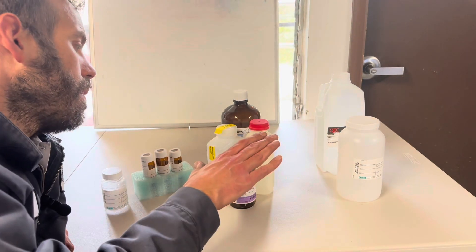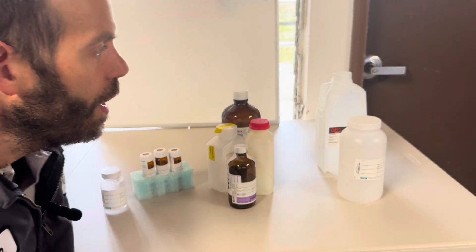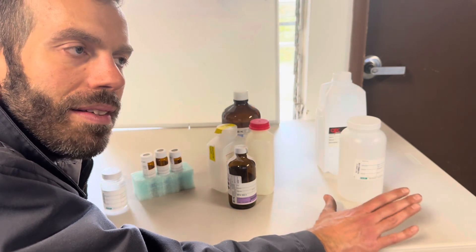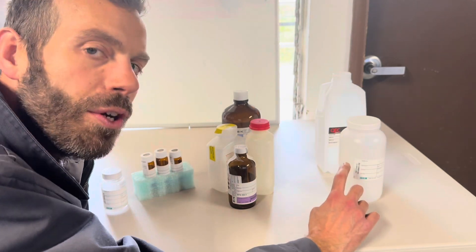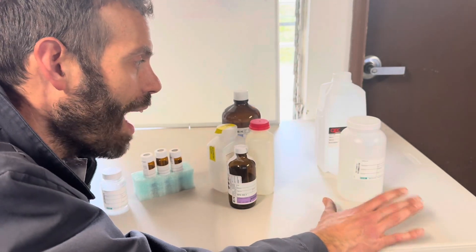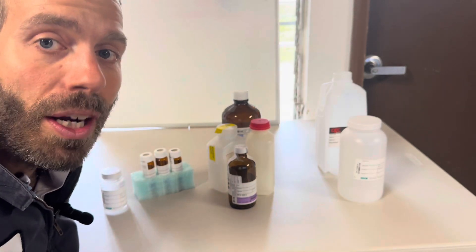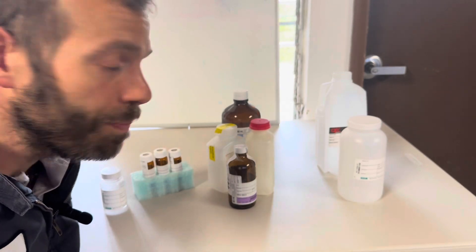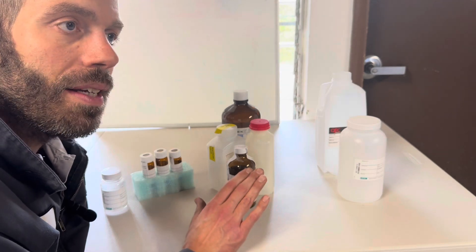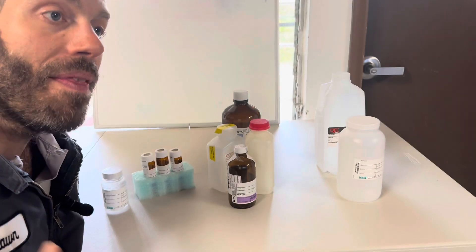There are lots of sample bottles here. You've got polyethylene unpreserved, poly and amber glass preserved, VOA vials, and bact jars. You're probably not going to be tested on unpreserved polyethylene bottles specifically — what changes is what method your lab uses and how much sample they need. But over here are the preserved samples, and you will be tested on these.